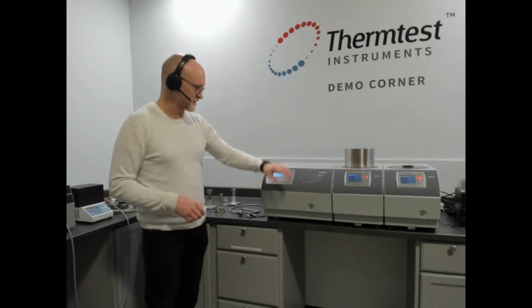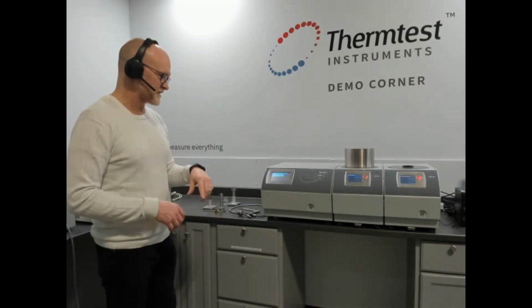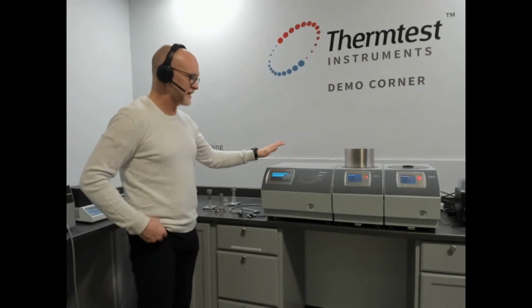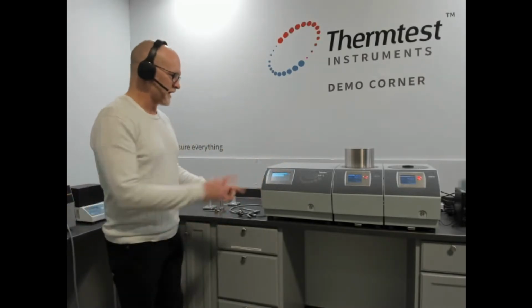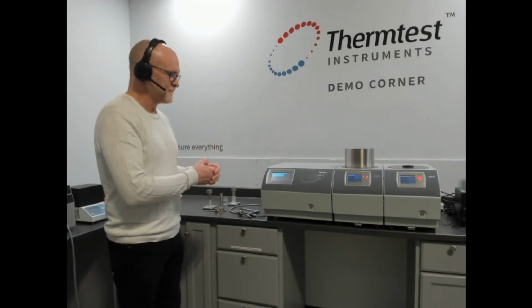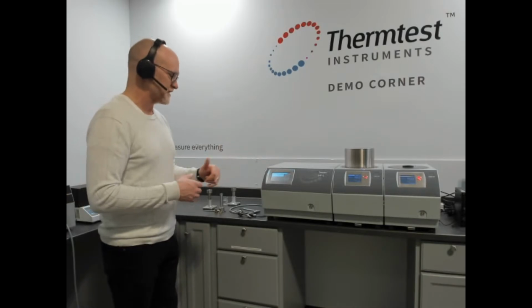There's one port in the front and 3 ports in the back, and you can even expand that to another 8 ports. The point being that you can attach multiple devices to the same controller. So every MP-1 controller comes with that capability. There's a smart screen for showing you which port is being measured at different points, and the software we've built to take advantage of those ports has the ability to schedule multiple sensors and or temperatures at the same time.